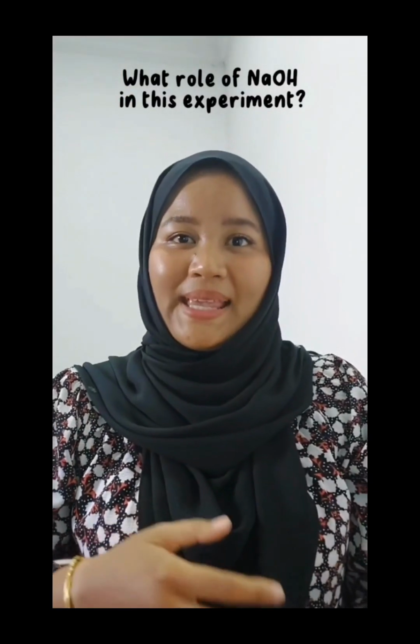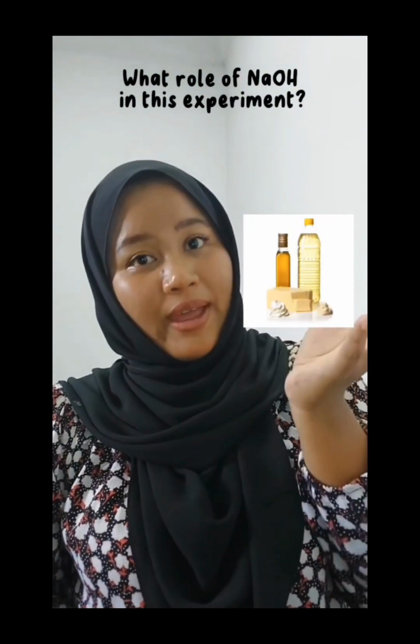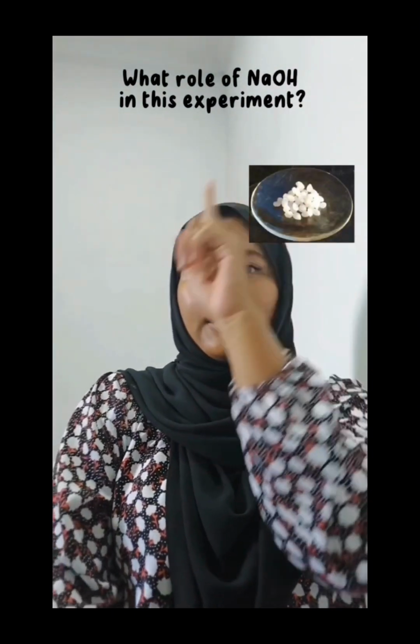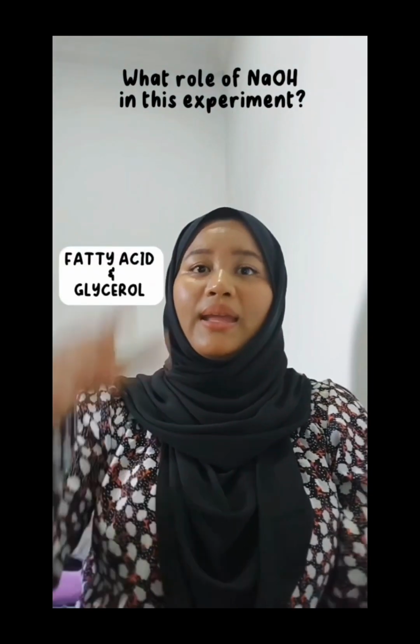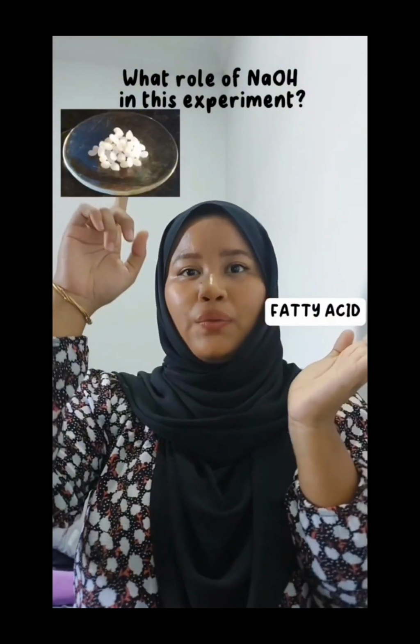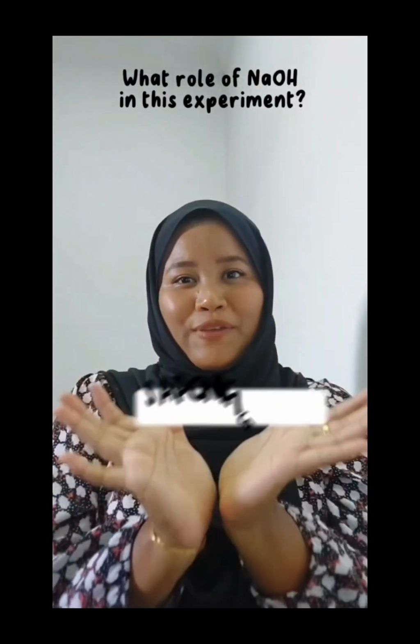The answer to this last question is: the role of sodium hydroxide, also known as NaOH, in soap making is to saponify the oils and fats used in the recipe. Saponification is the process of converting oil and fat into soap by reacting them with an alkali such as NaOH. When NaOH is added to the oil and fat, it breaks down the triglycerides into fatty acids and glycerol. The fatty acids then react with the NaOH to form soap molecules and glycerol. This chemical reaction is called saponification.